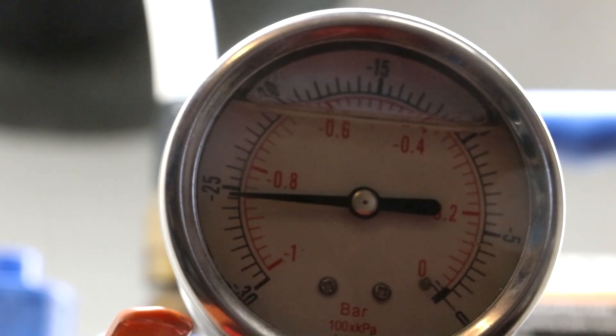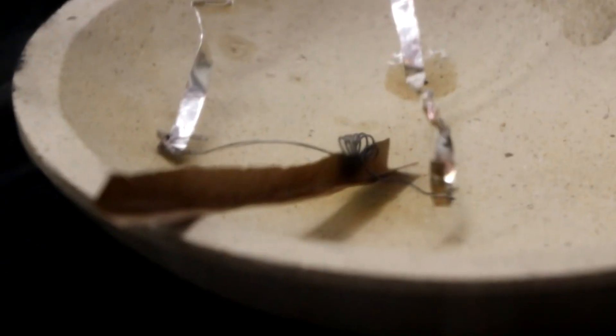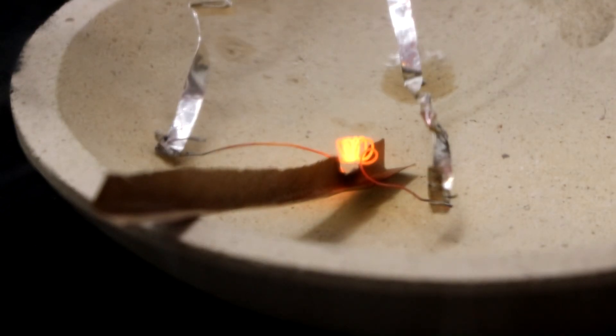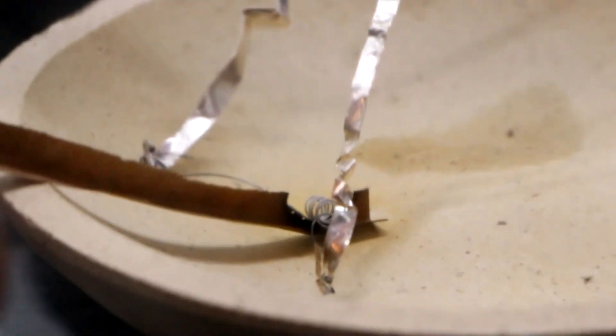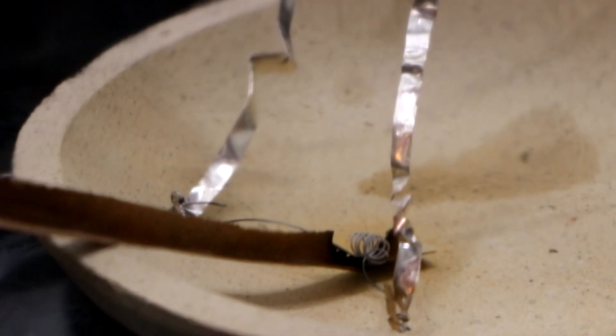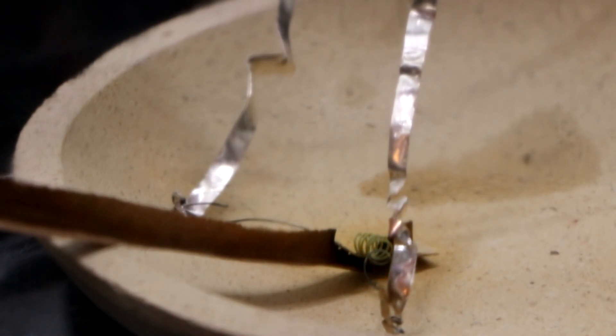Now I'm going to let in just a little bit of oxygen. There's about half an inch. Let's try igniting it again. Some embers are going. Okay, just shaking the chamber around a little bit so that the coil makes contact. I'm going to turn it on once again.